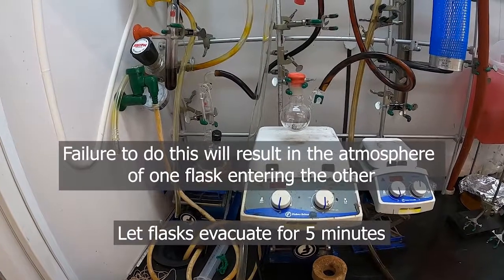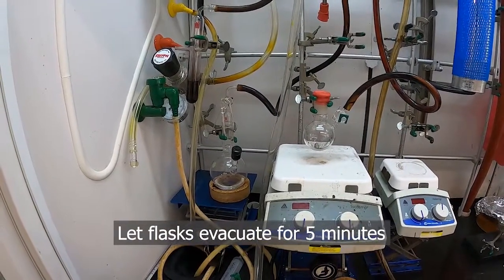All right. And then we'll let that pump on those for five minutes, and then come back to do a gas refill.